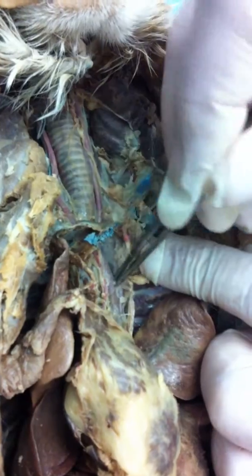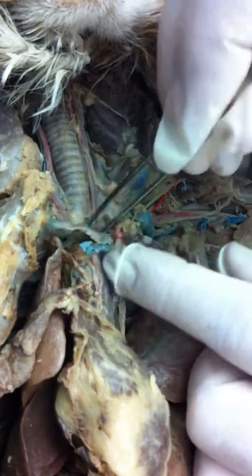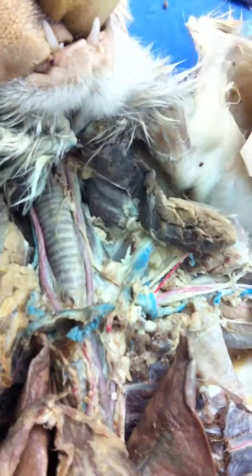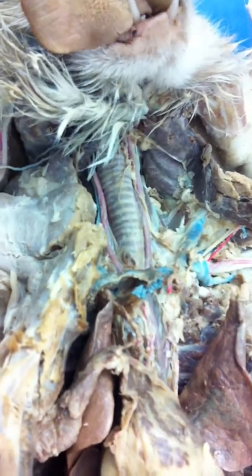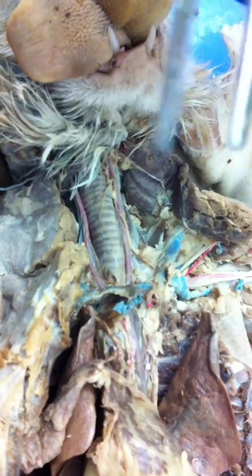The right subclavian and the... Can't tell what comes after. Oh, it gets real clear. Look at this. See this branch and this branch? What are those? Common carotid. Right and left common carotids. That's pretty good. So all we got to do is find the right subclavian, and we'll pretty much have it done, won't we? Okay.